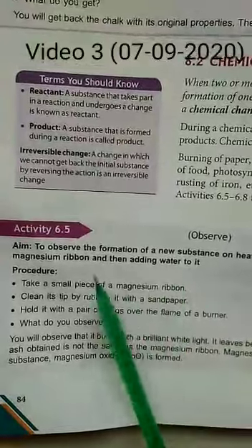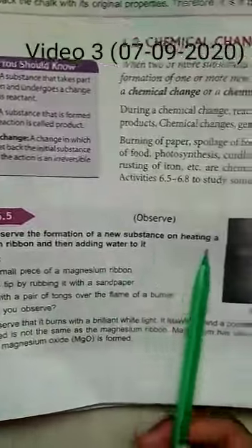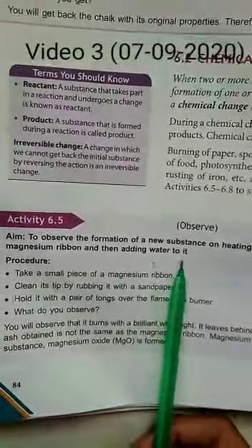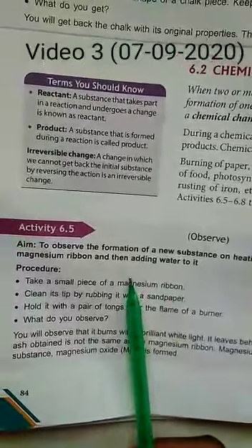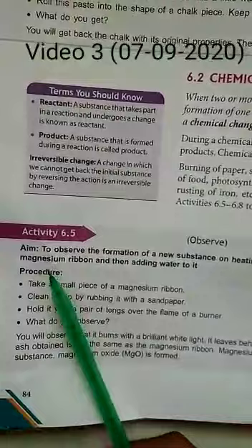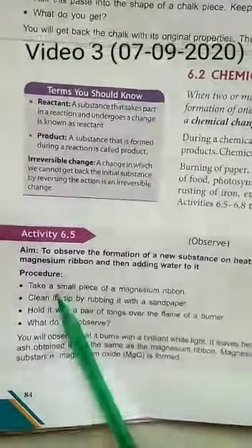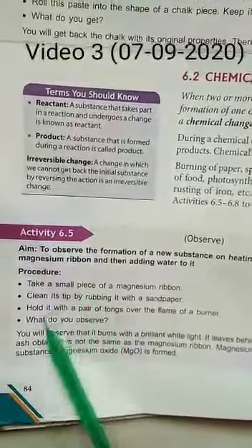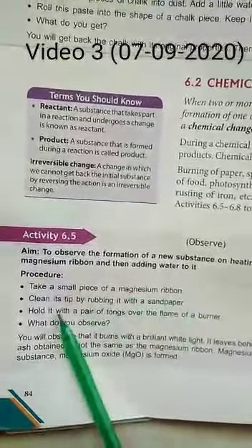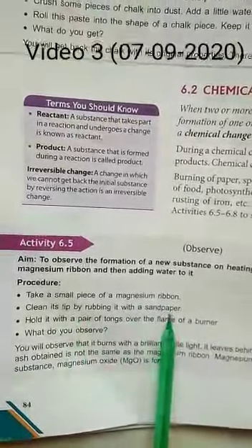Let's perform Activity 6.5 to observe the formation of a new substance on heating magnesium ribbon and then adding water to it. This activity needs magnesium — symbol Mg, capital M small g. Take small pieces of magnesium ribbon and clean its surface by rubbing it with sandpaper.